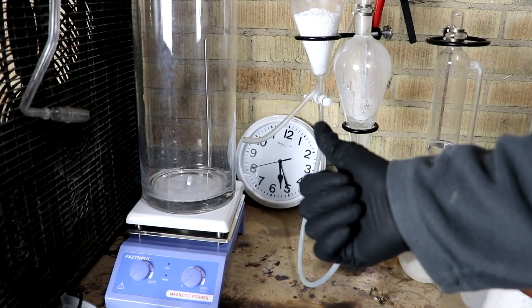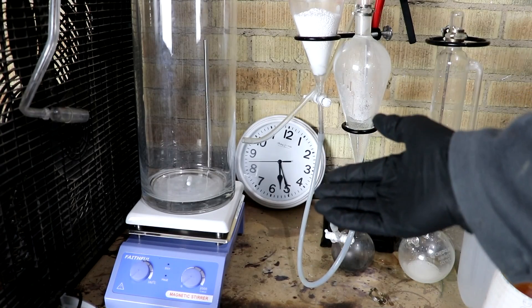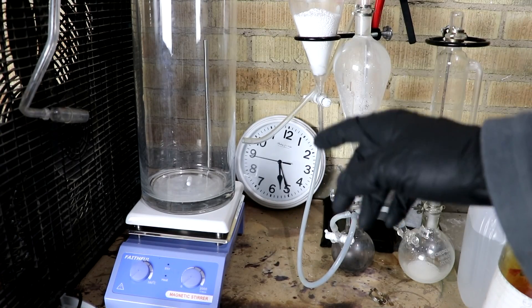Hi everyone, welcome back to Cody's Lab. So today I'm going to attempt to make sulfuric acid using the chamber process.